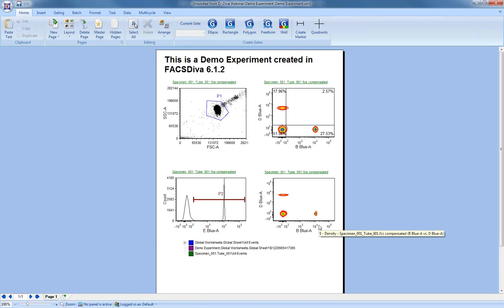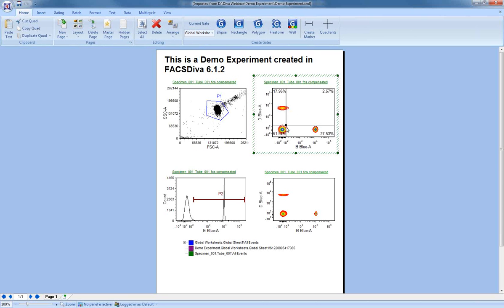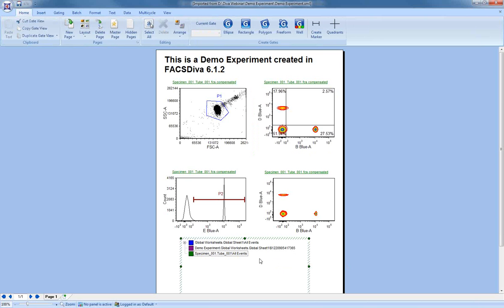And now you can see that everything was imported into FCS Express. We have the same plots. We have the same contour plot with the quadrants. We have the same gates, and the same markers got recreated in FCS Express. Okay, one difference you'll find is that in Diva there were statistics associated with the gate. FCS Express does not automatically, in its hierarchical gate view, include statistics.